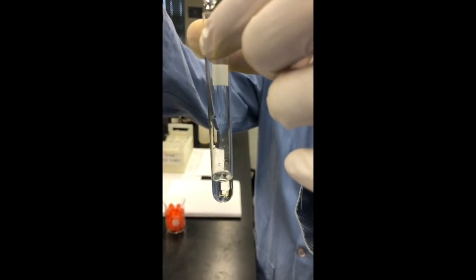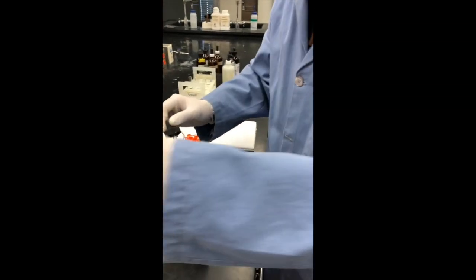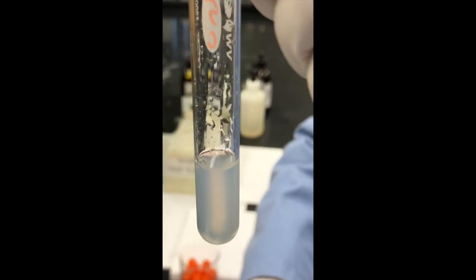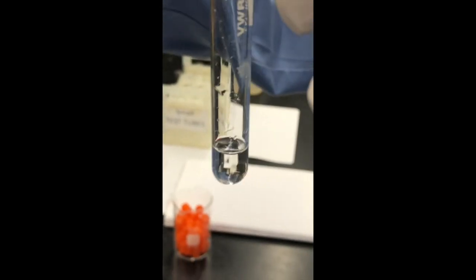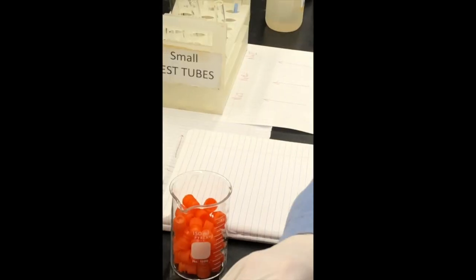Moving on to strontium ion. The strontium ion with sulfuric acid, then with sodium carbonate, then with oxalate, and finally we will perform the last test: strontium ion with acidic solution of potassium chromate.